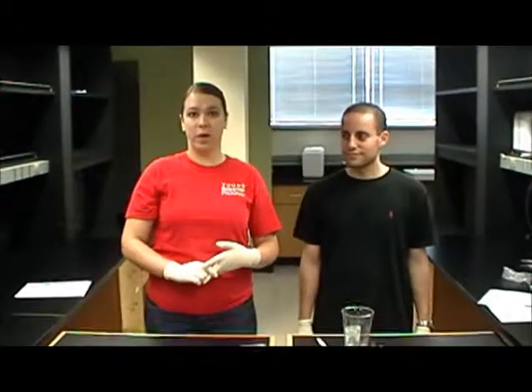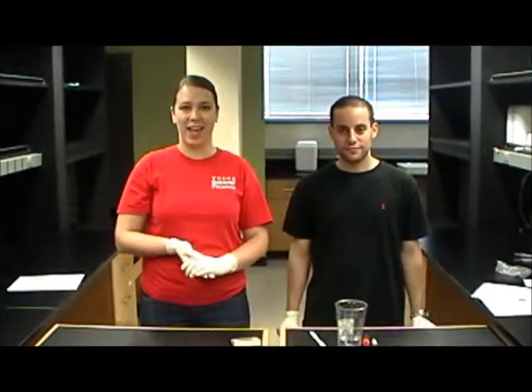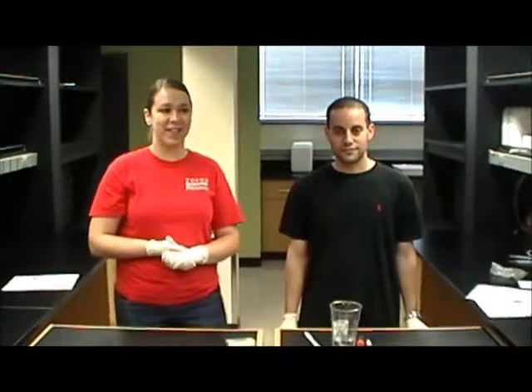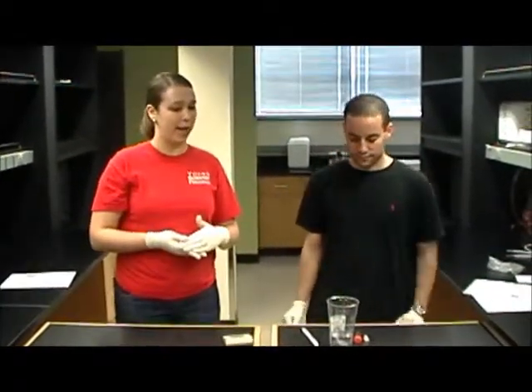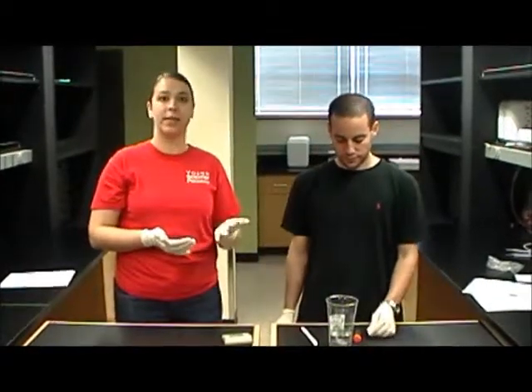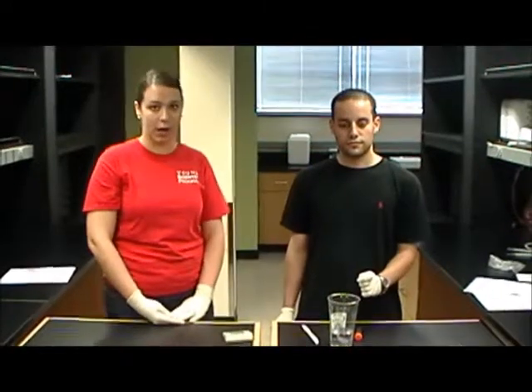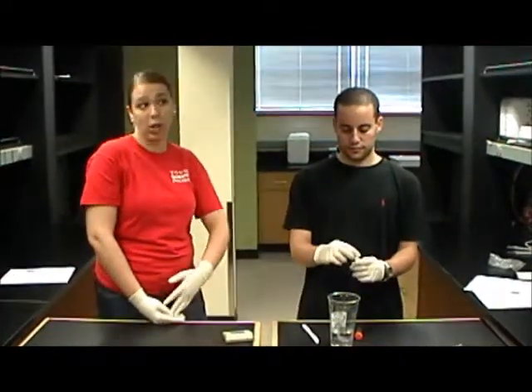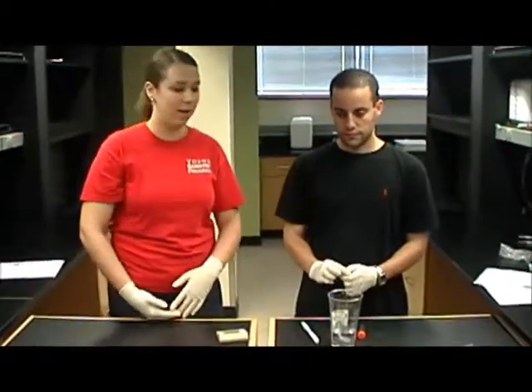First off, for this part of the experiment, it's important to make sure the students are all wearing gloves so they don't get any iodine on their hands. To start, we'd like you as the teacher to gather the students around and demonstrate to them, like we said, that when you mix iodine and starch together, it creates a purple color, so that they know what color they're looking for in their experiment with the Ziploc bag.